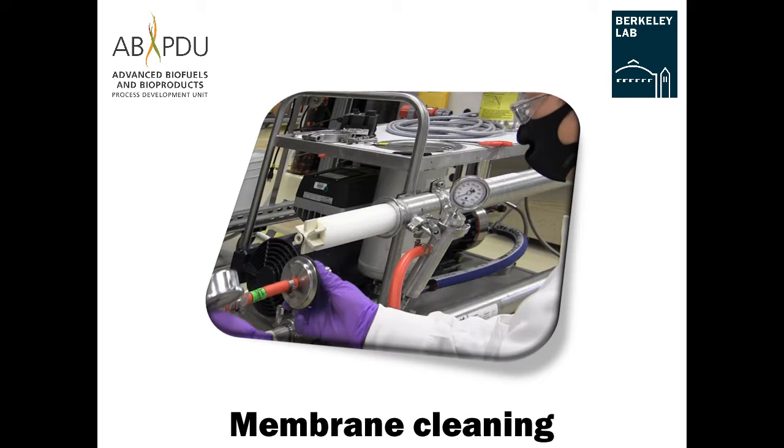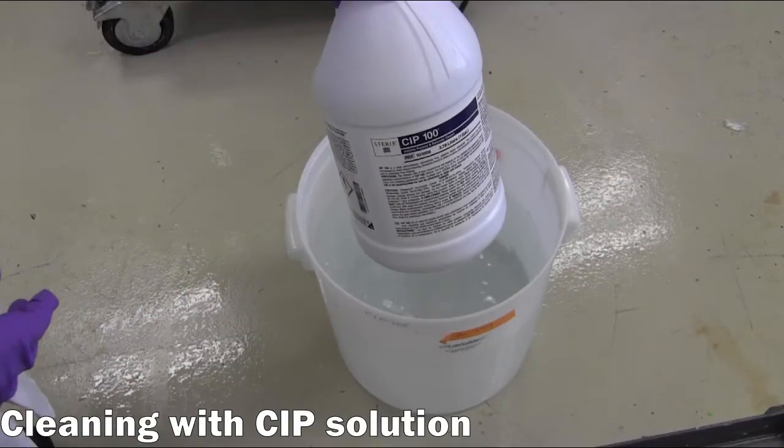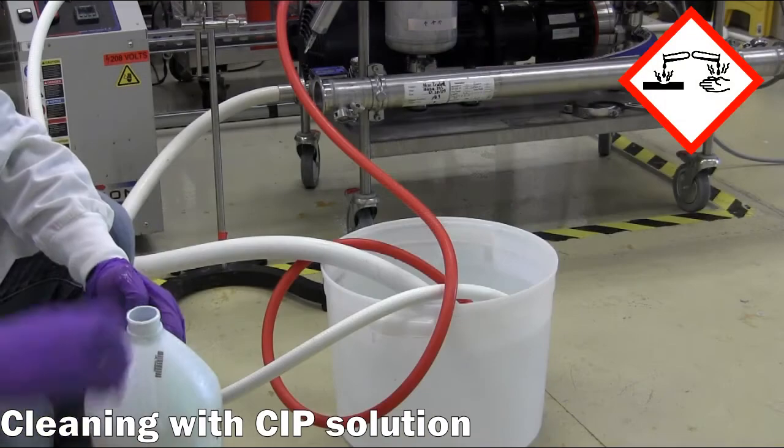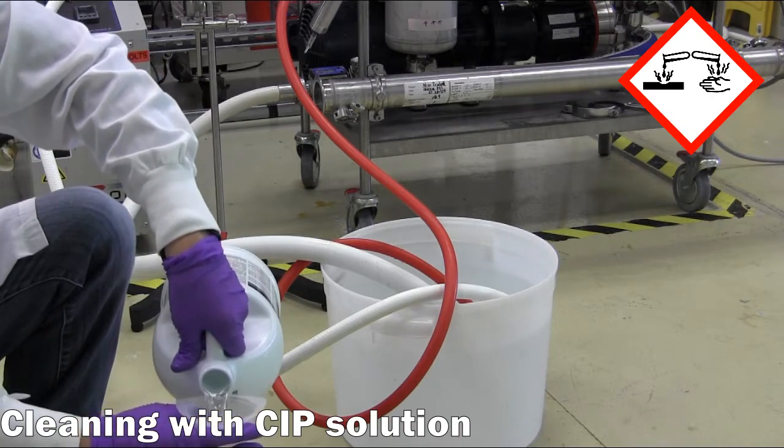Membrane cleaning: Membranes may be coated with a layer of glycerin or other storage solution and must be thoroughly cleaned before introducing process material.